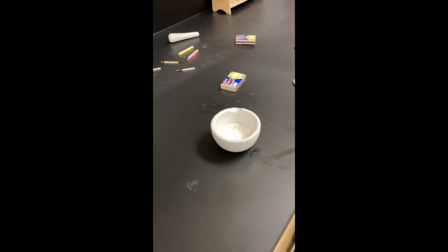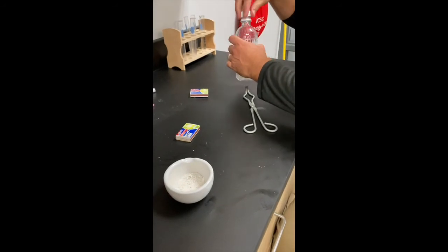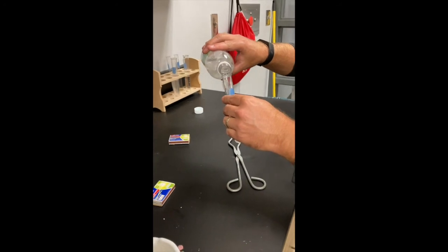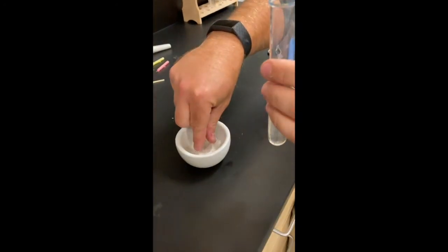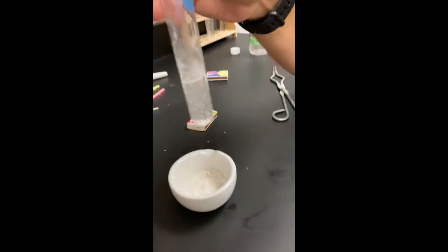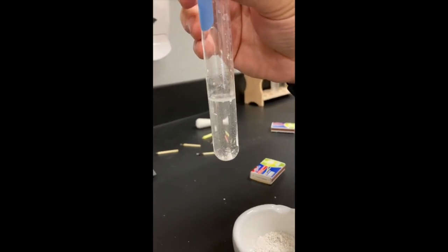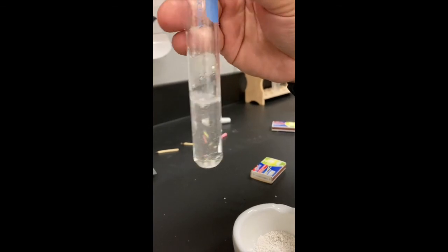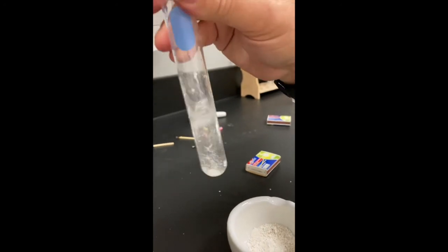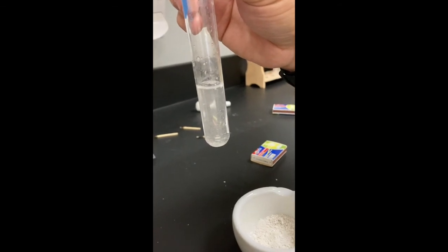Number 5 is we mix it with vinegar. I'm going to shake up my vinegar a little bit, but this is just regular distilled white vinegar. And I'm going to pour it into this test tube. And then I'm going to take some of this chalk, and I'm going to put it in there, and I'm going to mix it up. And you're going to look, and you're going to decide if this is a chemical change or a physical change. And you're going to say why you think it's a chemical change or a physical change.